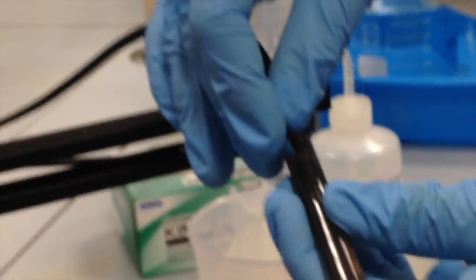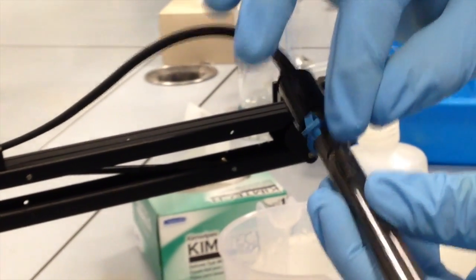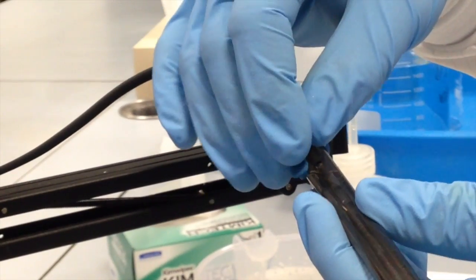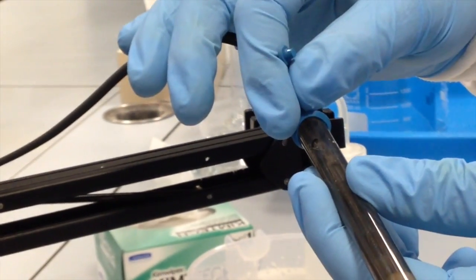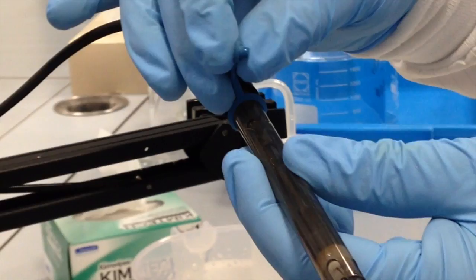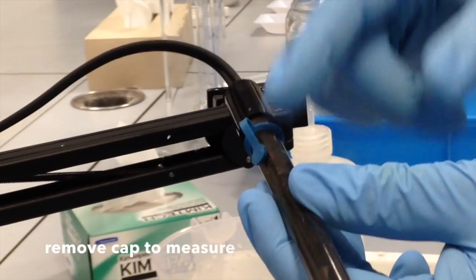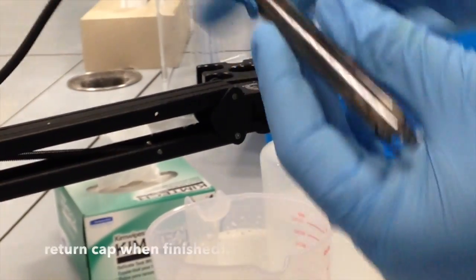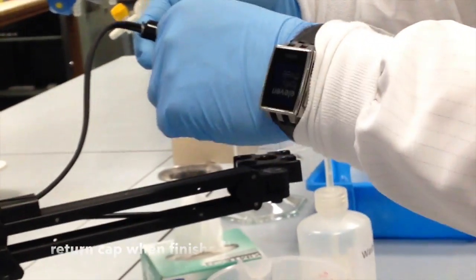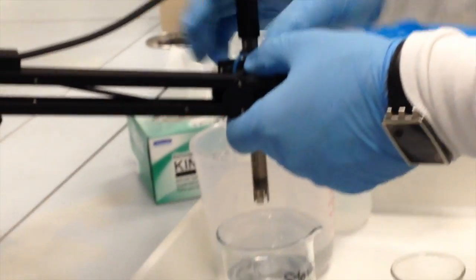The other thing is that the probe will not give you good data unless you open up this vent. There's a small cap that prevents the electrolyte solution inside from evaporating. But you have to remove that cap in order to take a good reading. The cap must be removed while you're measuring, but once you're finished measuring, you must replace the cap and press it into place so that the solution inside remains at the same concentration that it's meant to be. So since I want to take a measurement, I can open up that vent. I can place my probe inside this arm just to keep it steady.